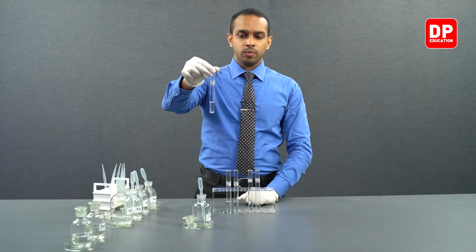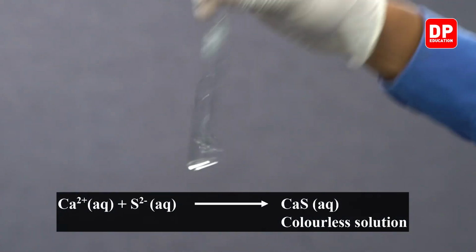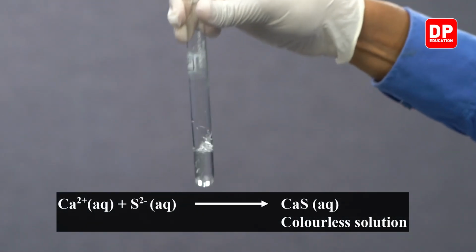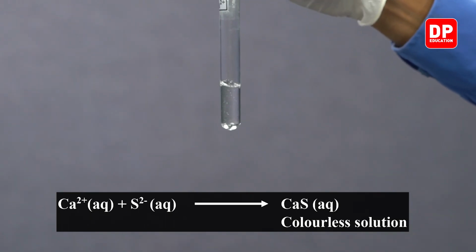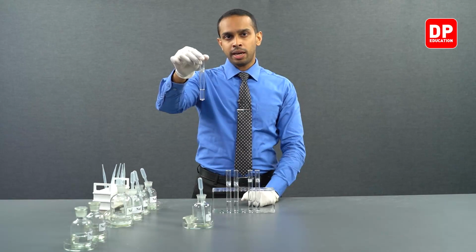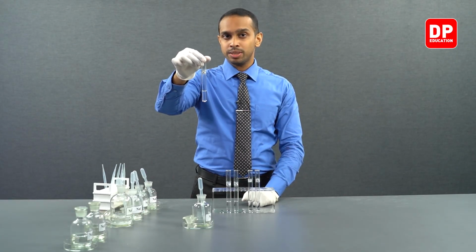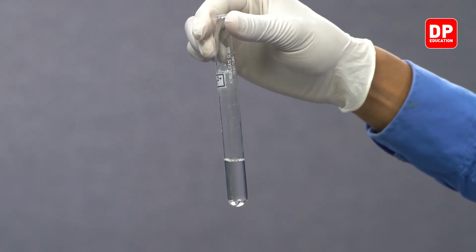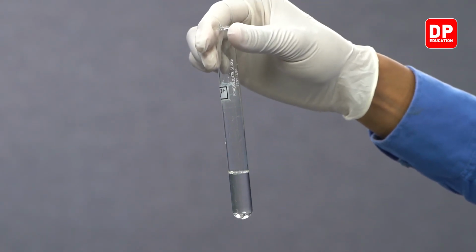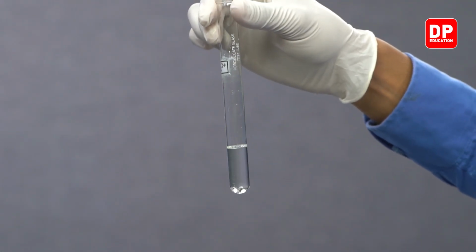As you can see, upon addition of sodium sulfide, we did not see a change. Let's mix it really well and see if that brings about a change. No. In the presence of calcium 2 plus ions and sulfide ions, we form calcium sulfide. Calcium sulfide is water soluble.